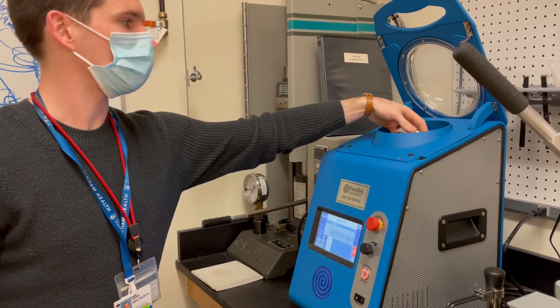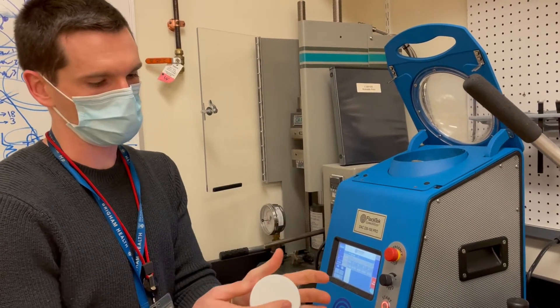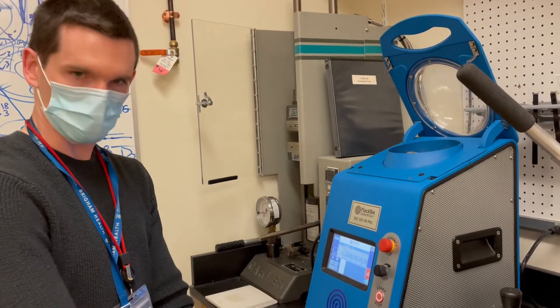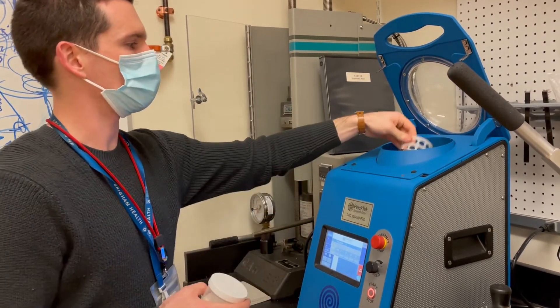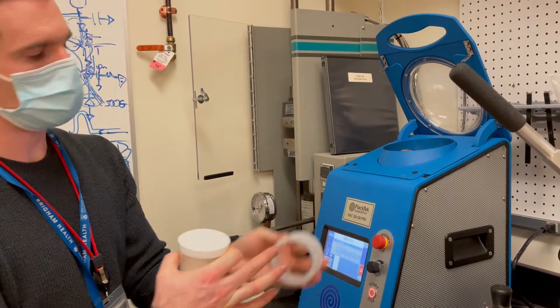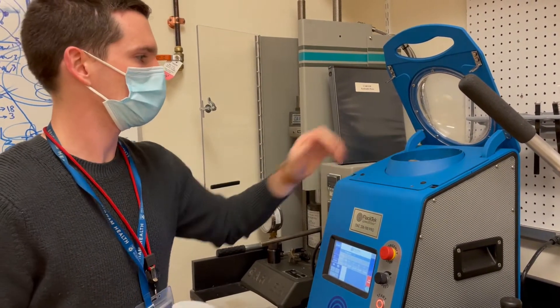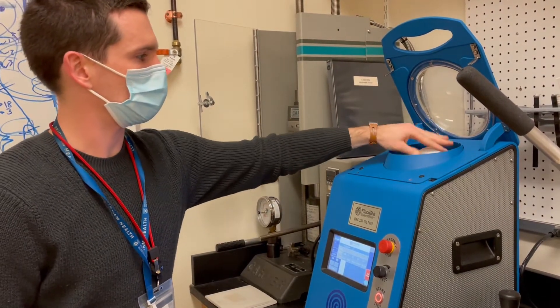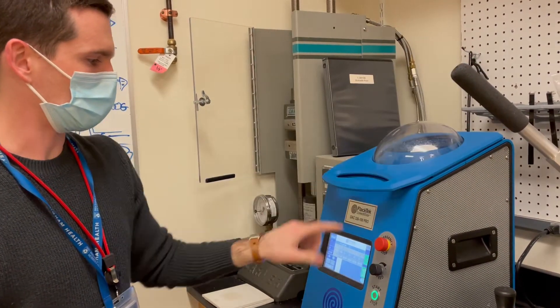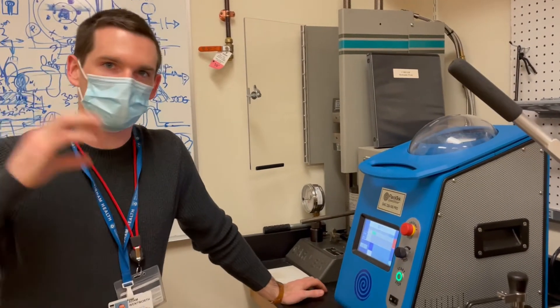There's a little holder in here — there are two different holders that come with the machine. This one fits this cup, and you'll find the other holder in these drawers. The cup holder has three slots so you want to make sure it locks into place in the metal ring on top. Then just slide the cup in there and close the lid.